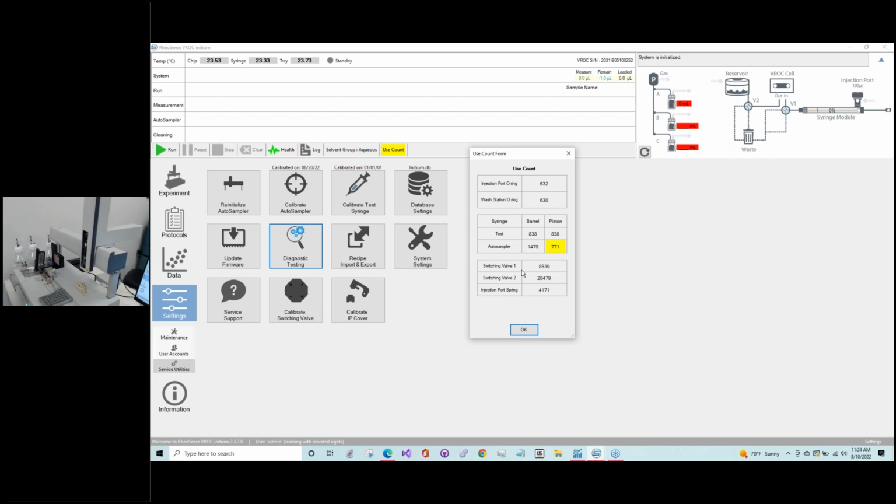So now back to the test syringe, because we are going to do some demonstration on how to handle that yourself. I just want to point out that we have two different parts to replace. One is the barrel of the syringe, so that's the glass barrel, and the other is the piston. The use count on the barrel, because it's glass, is more durable and holds up for a longer period of time, so it is higher than the use count on the piston. So the pistons will expire before the barrels do, because the tip of the piston is, I believe, Teflon, PTFE. It is quite durable, but over time it will loosen in the barrel and cause some issues in terms of testing and function.